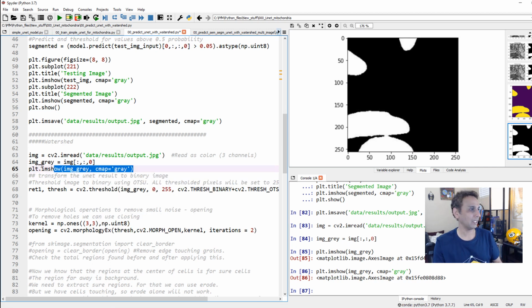Just to prove that we got our original image back after saving it and reading it as 3-channel and extracting only the 0-channel. No surprises there. Now let's go ahead and threshold this image. Right now it may not be, in this case, it looks like it's thresholded, but let's go ahead and perform an OTSU thresholding.